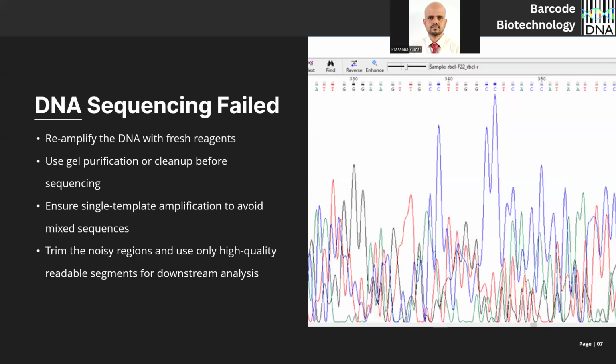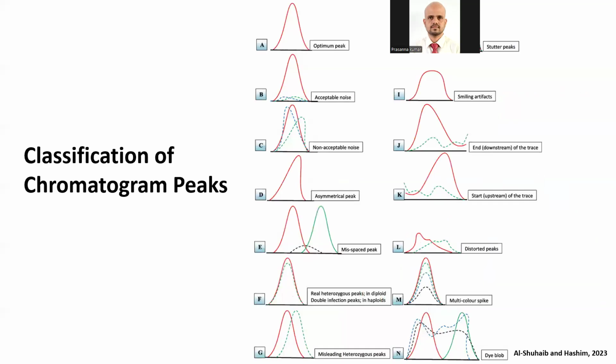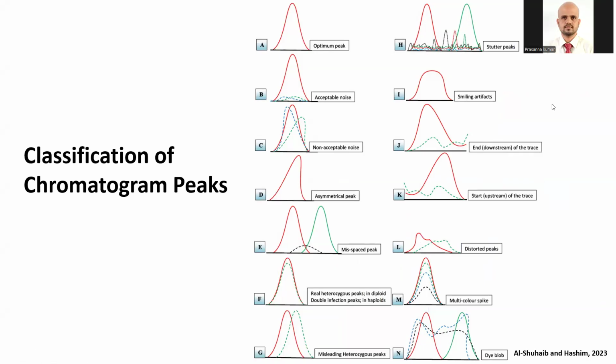So to sum up, I want you to see this classification published by these authors. This is an optimal peak, peak A. Peak B is still acceptable. If you have multiple peaks like this from a single position, not acceptable. This is an asymmetric peak. Misspaced peak: you should be very careful about the nucleotide called at that peak position. Here we have a heterozygous peak in the diploid. These are typical SNPs. Misleading heterozygous: look for the calls at the top of the nucleotide text.